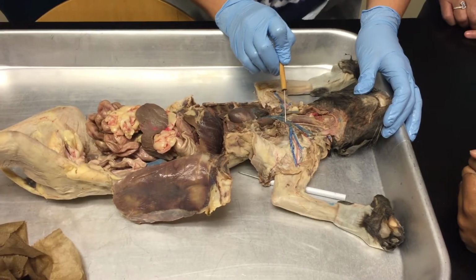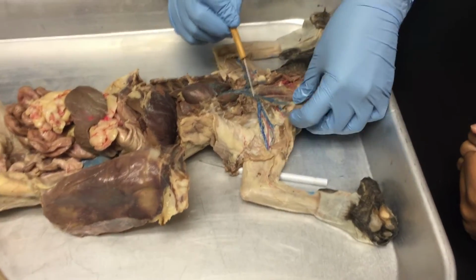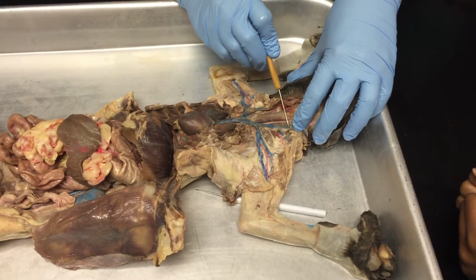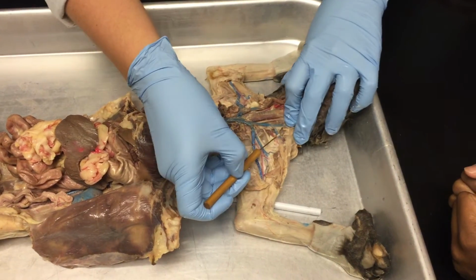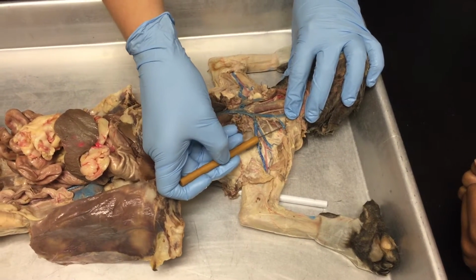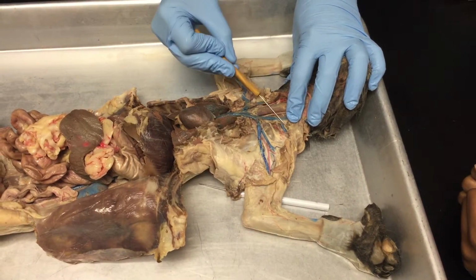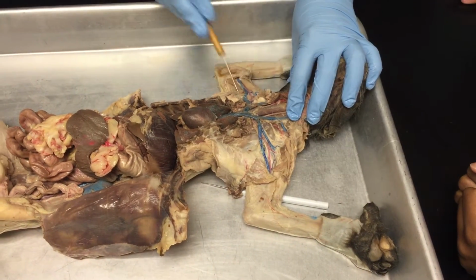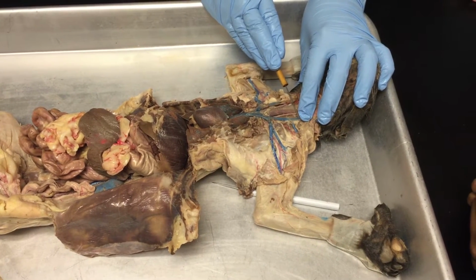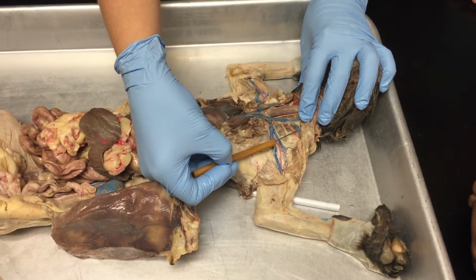Fantastic. So here's the brachiocephalic, and then it's going to branch, this vessel coming up. And I know it's kind of off to the side, but I'll pull it up. This going to the head, this is the left external jugular vein. The branch that comes off of it, right here, at the top, this is the transverse scapular. This is the transverse scapular because it traverses the scapula. It goes to the back. So left brachiocephalic, this first branch going up to the head is the left external jugular. This is the left transverse scapular vein.